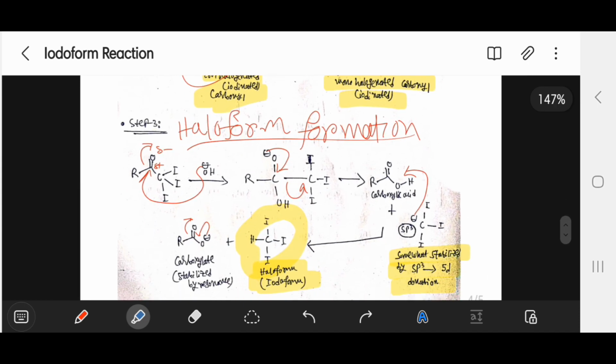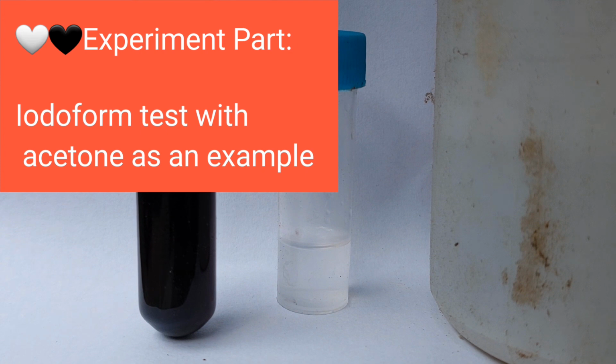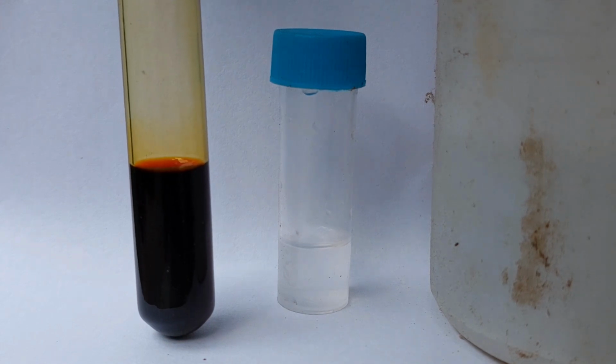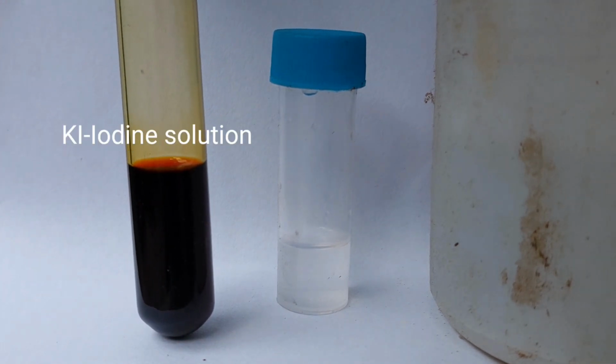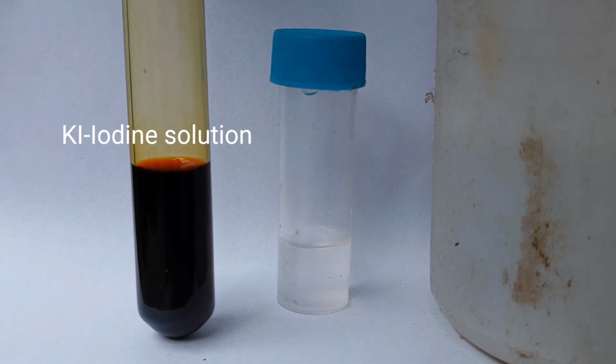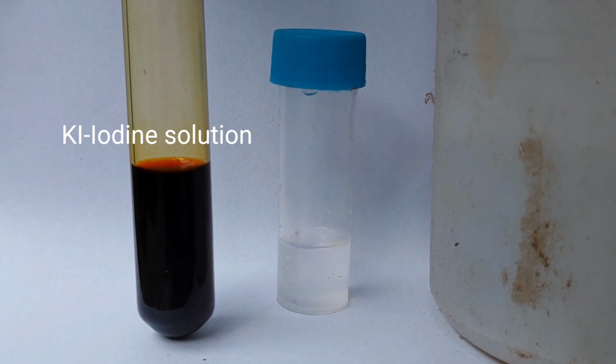the reaction part quickly. Let me welcome you to the experiment part of this section, and I will be using acetone to perform iodoform reaction, but you can use anything else as I've shown before. So we will basically need iodine solution, and this iodine solution can't be prepared on its own, so we add iodine crystals to distilled water, and then we add some amount of KI.